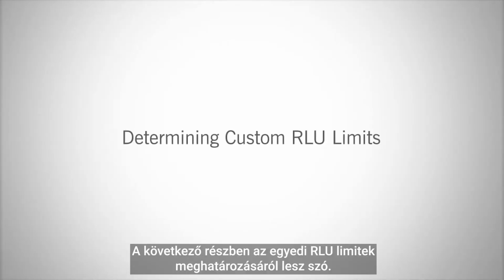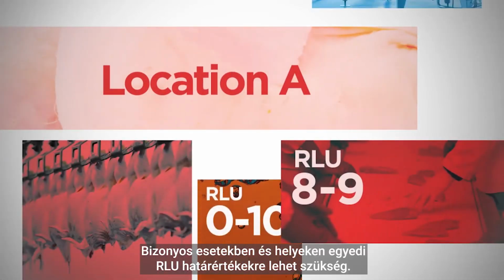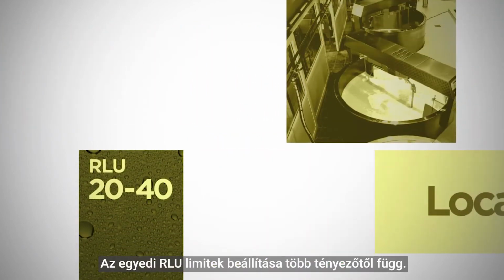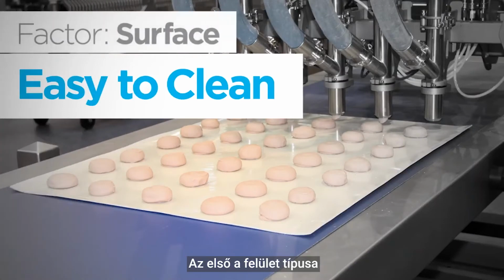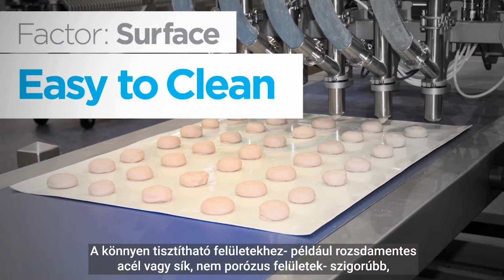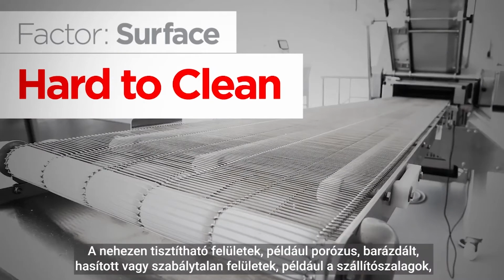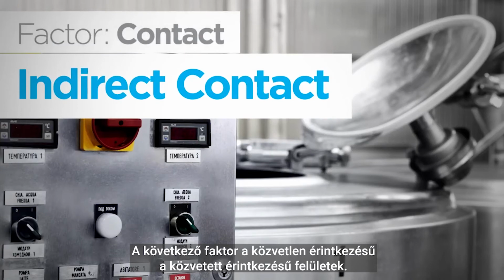The next section is determining custom RLU limits. In some cases, custom RLU limits may be required for certain locations. Programming custom RLU limits depends on the following factors. The first factor is the type of surface. Surfaces that are easy to clean, such as stainless steel or flat, non-porous surfaces, may have stricter, lower limits. Surfaces which are hard to clean, such as porous, grooved, creviced, or irregular surfaces like conveyor belts, may have higher limits.